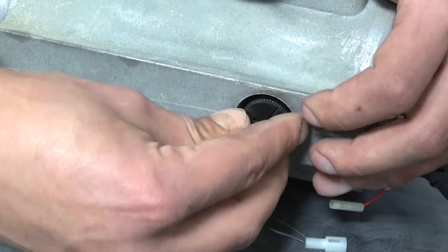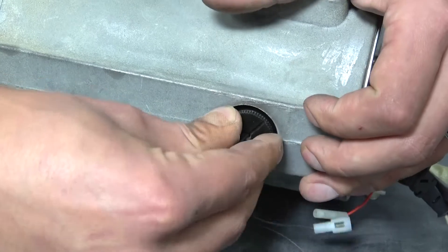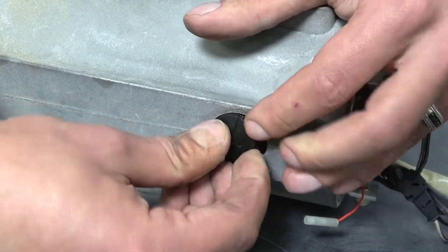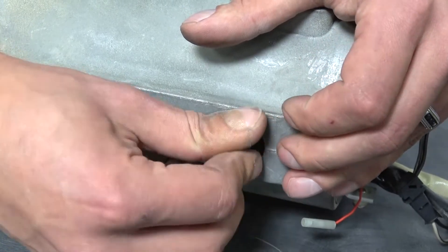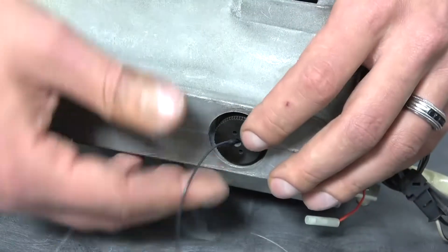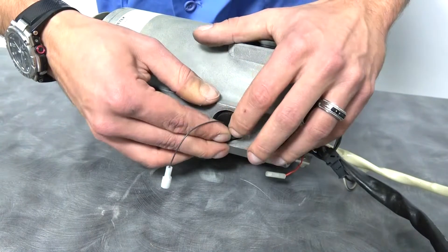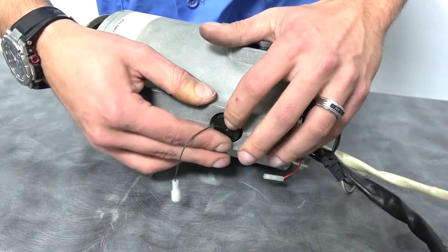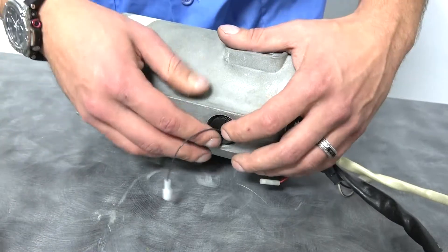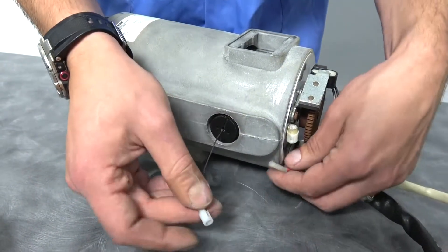It's all about just figuring out the best way. And there we go. At the end you don't really need to tighten this down too much. You don't need to bring your screwdriver over to tighten it. Just hand tight is going to be good. Don't forget to reconnect your connector.